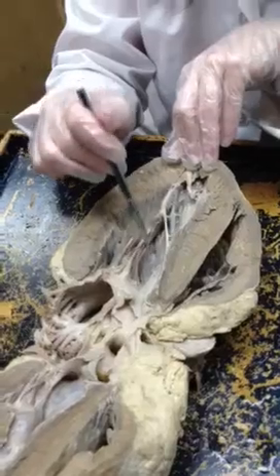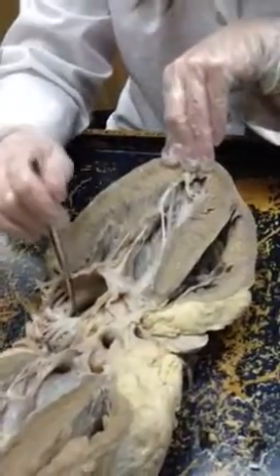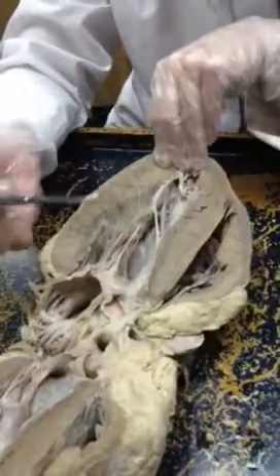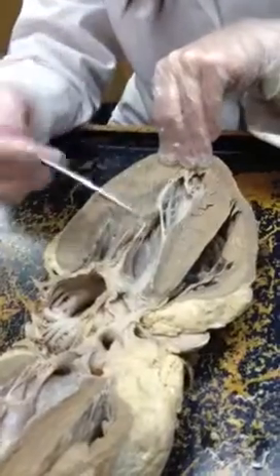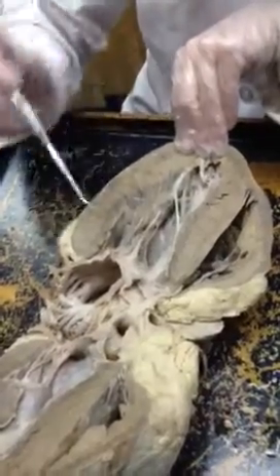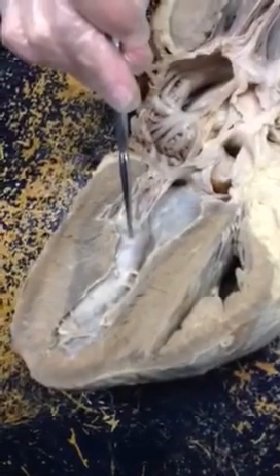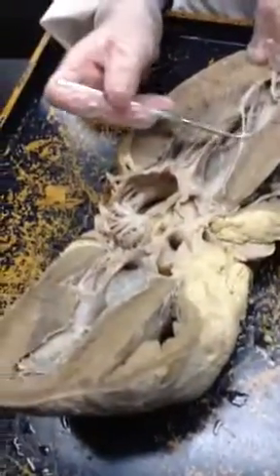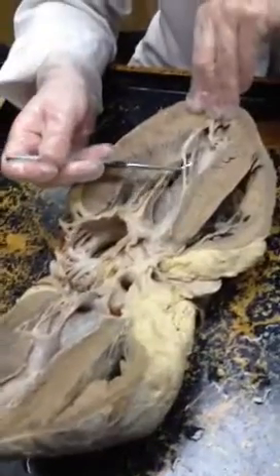If it's here and has a card that says 'be specific,' then that's the left ventricle, right ventricle, left atrium, or right atrium — be specific on the chamber. If it's pointing to the big bulgy part and it doesn't say layer and doesn't ask for chamber, we're looking for papillary muscle. The big bulgy parts are papillary muscle — the chordae tendineae attach there.